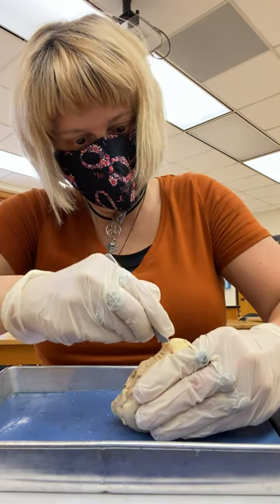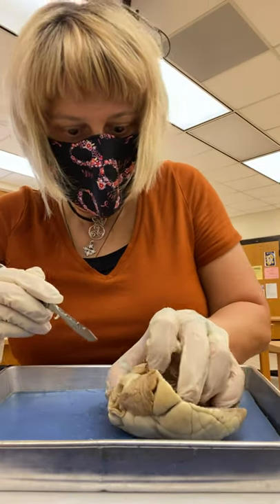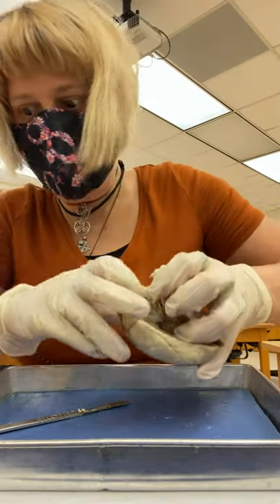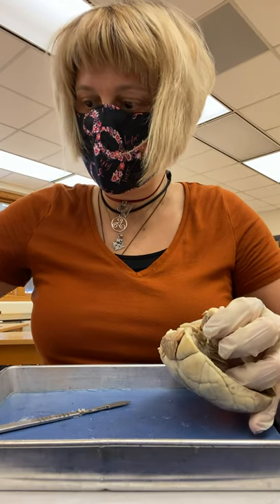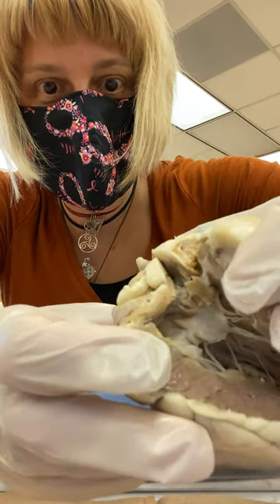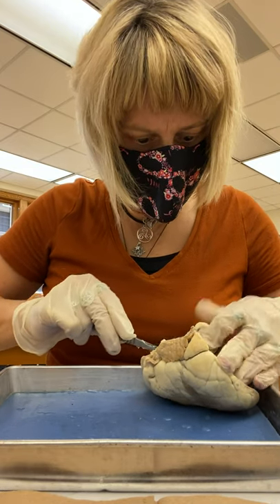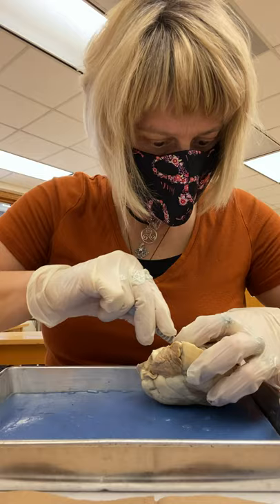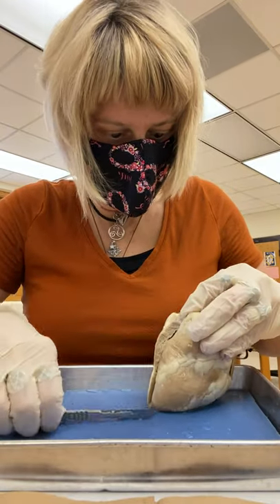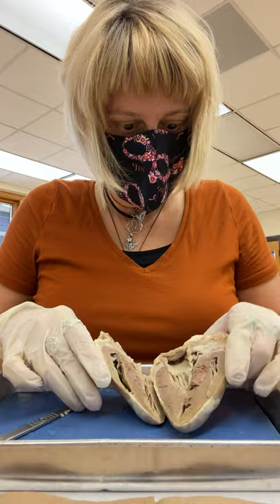And I'm coming back around. Before I open it up, I just want to show you how strong the chordae tendineae are — literally, I can see the valve from here. You can see the chordae tendineae and the valve. I'm going to cut straight through now. Beautiful — there it is.